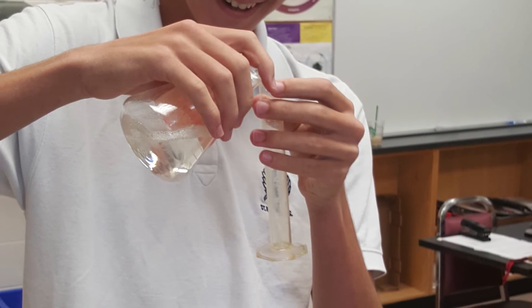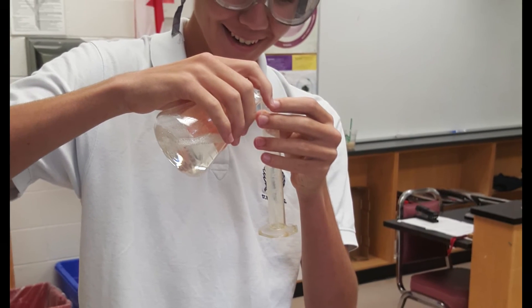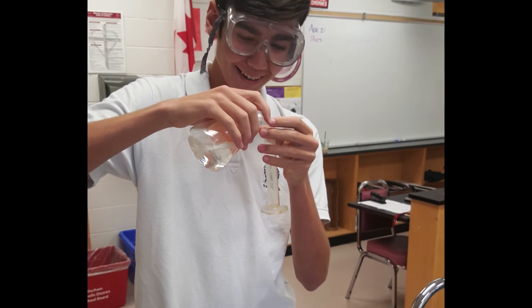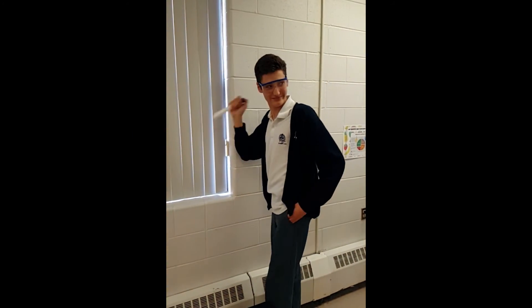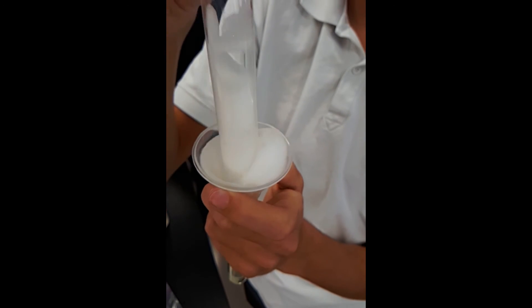Before shaking, the onion and DNA extraction mixture was a clear solution with some onion particles suspended within it. After shaking though, the mix was incredibly frothy, most likely due to the shampoo within the solution.